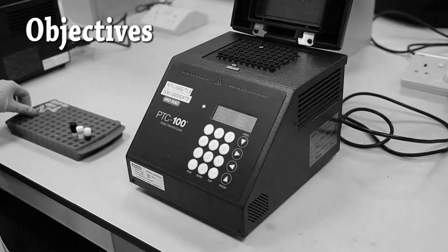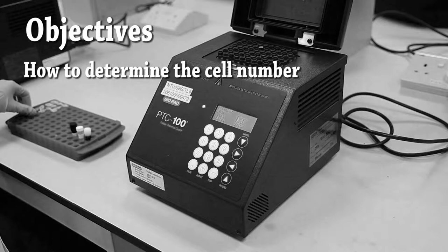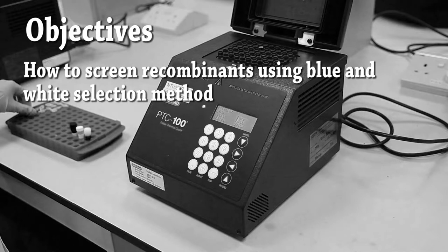Here are the objectives: hands-on experience in performing PCR and cloning, learning how to determine cell number, and learning how to screen recombinants using blue and white selection method.